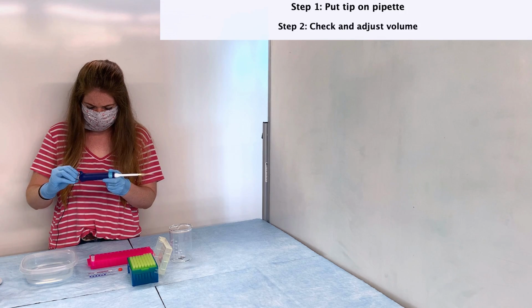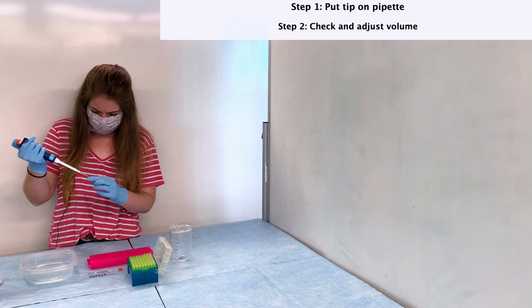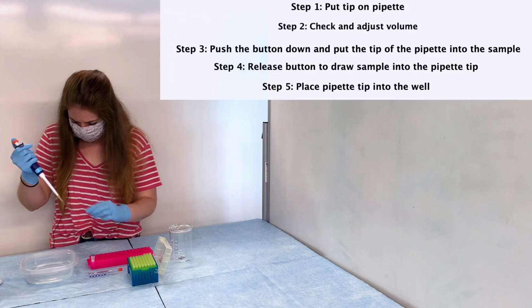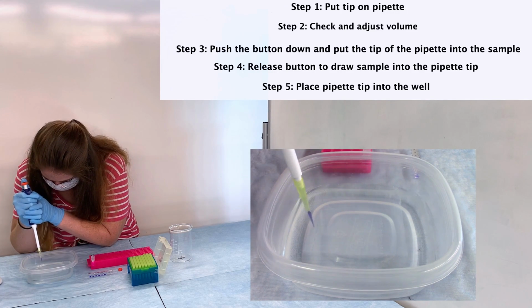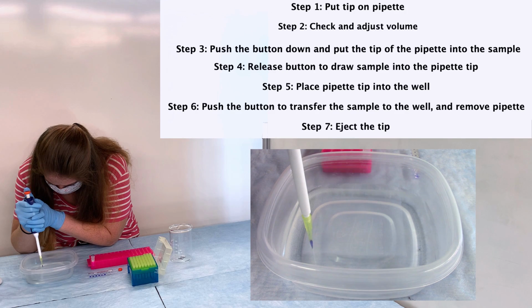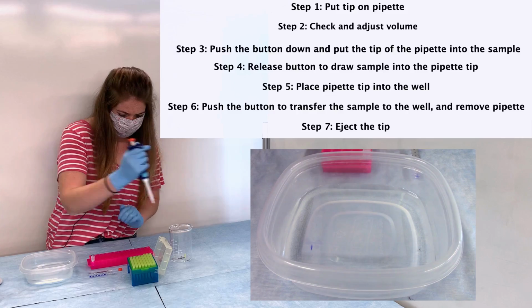To draw solution into the pipette, first I'm going to push the button down, then place the tip of the pipette into the sample, and finally release the button. Once the pipette is positioned into the well at the top of the gel, I will push down the button, which releases the sample. Before I lift my thumb, I will remove the pipette from the well. Otherwise, I would draw the sample right back into the pipette. After I finish with this first sample, I'm going to eject the tip. It's essential for this demonstration to change tips between each sample, otherwise contamination may occur and the DNA samples could get mixed together.